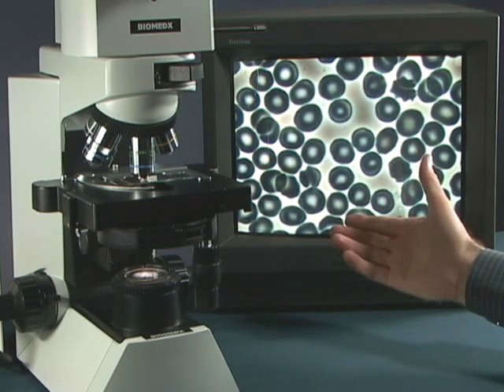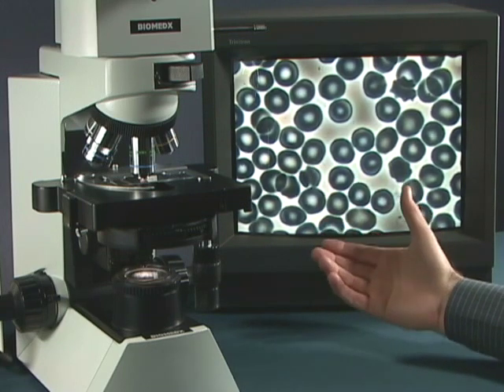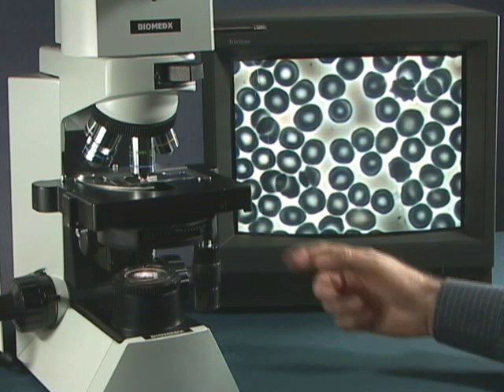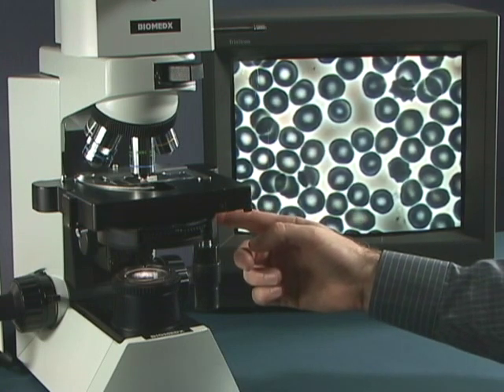So please, if your image starts to fade and you don't have the sharpness and the contrast that you've been used to, simply adjust your condenser.